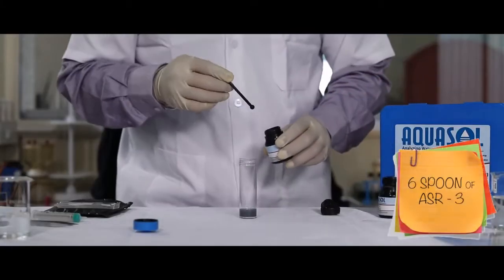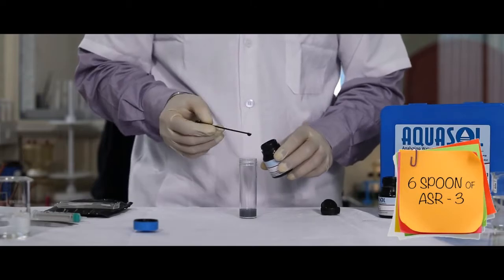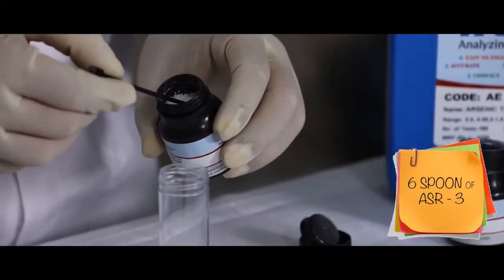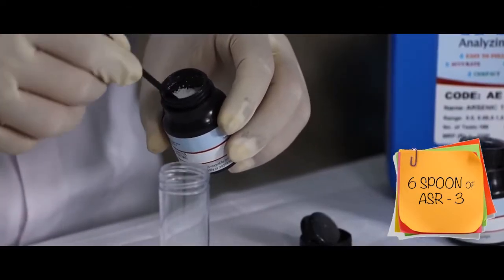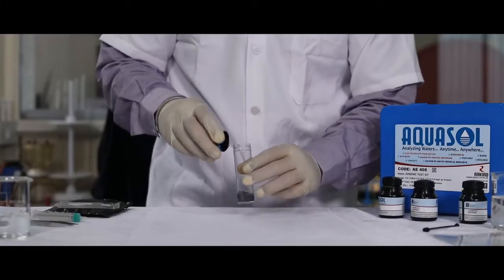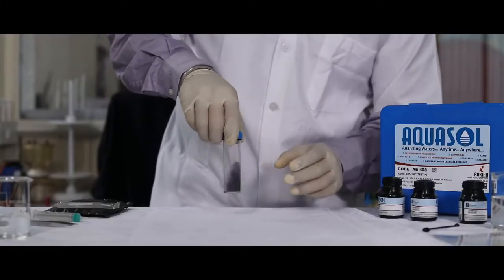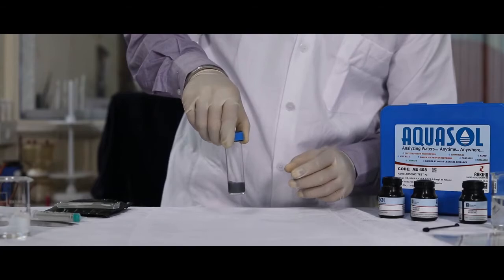Once mixed well, add 6 spoonful of ASR 3. Immediately screw the cap back and swirl the bottle gently to mix well.